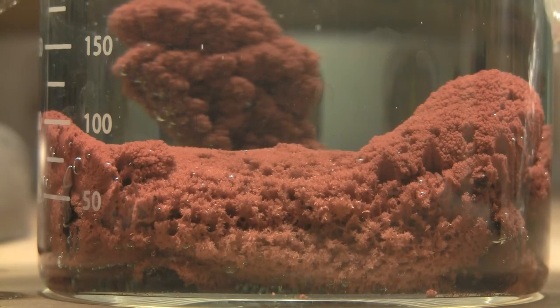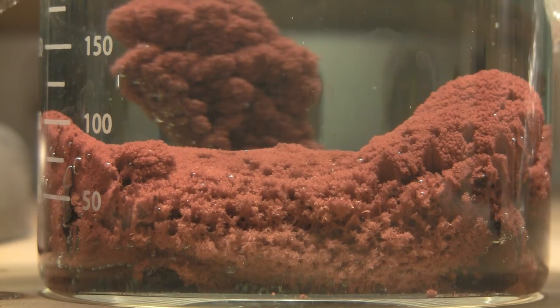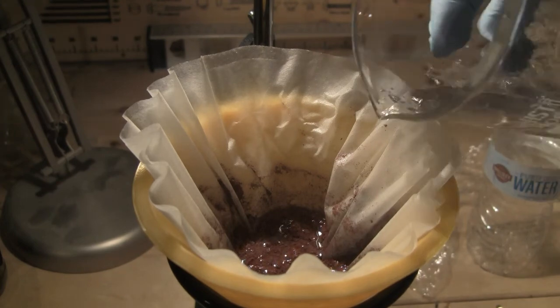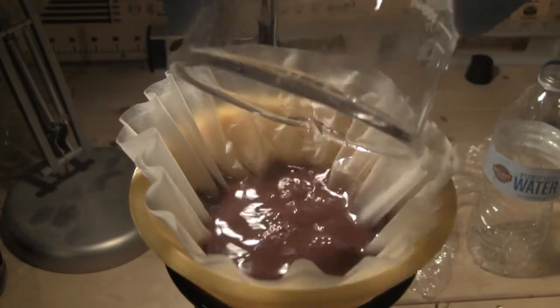The solution was allowed to sit for 24 hours, which resulted in a greenish iron 2 sulfate solution with fluffy copper crystals grown from the nails. The solution was filtered and washed with lots of water to remove leftover acid as well as copper and iron salts before being allowed to dry.